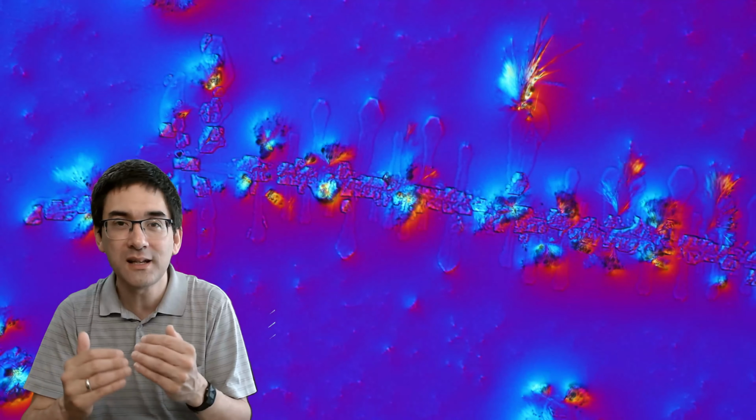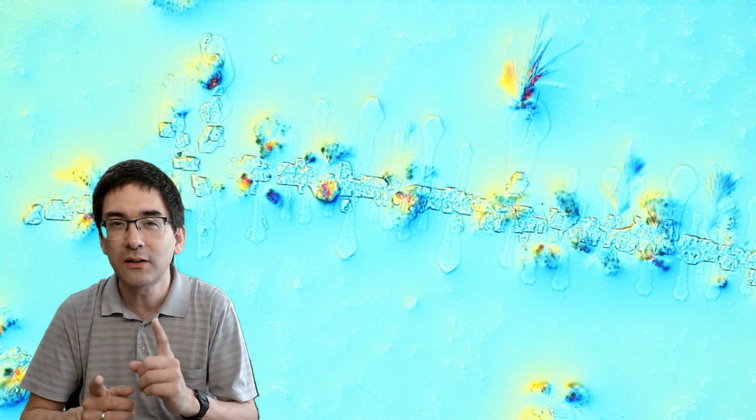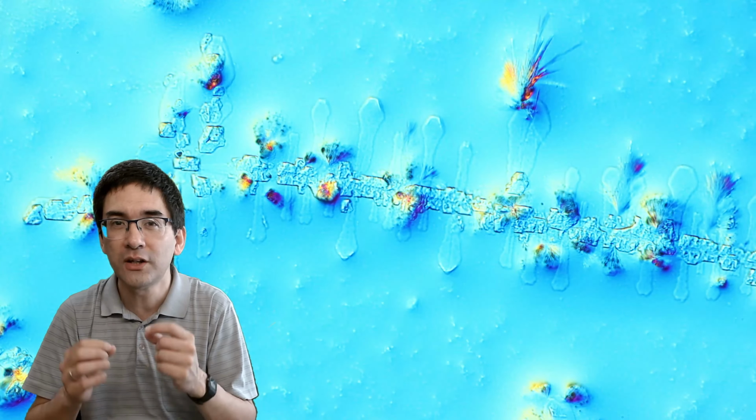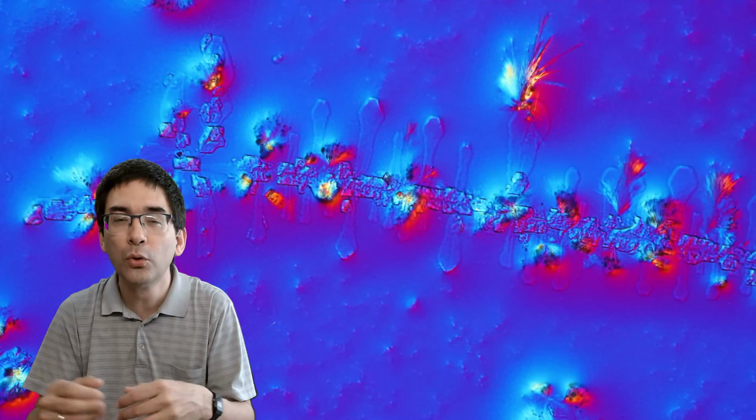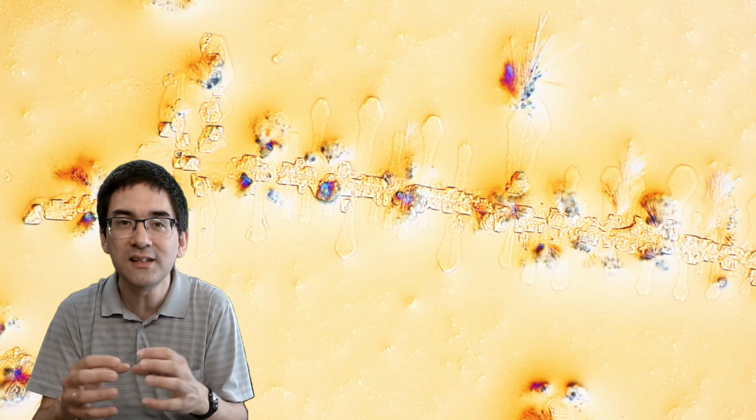Now, I've been shifting the prism around a little bit, and this has given me those beautiful color plays. One thing you can also try is to reapply more urine on the dried urine, because this way you cause more and more crystals to grow, and the existing crystals will also grow, and there will be more crystal deposited.